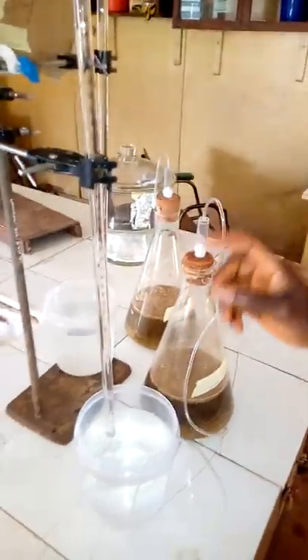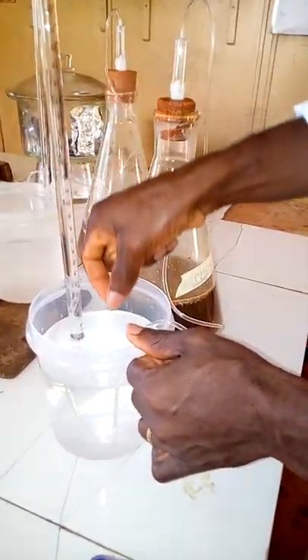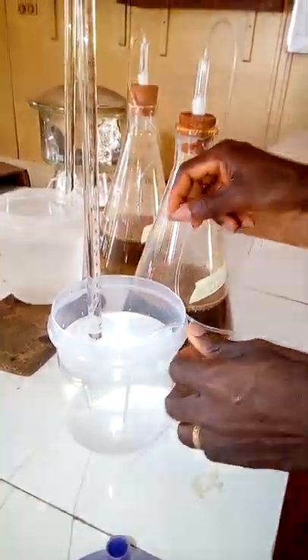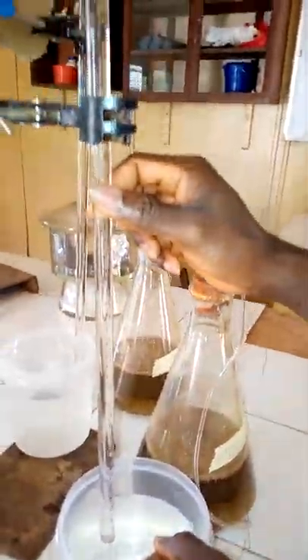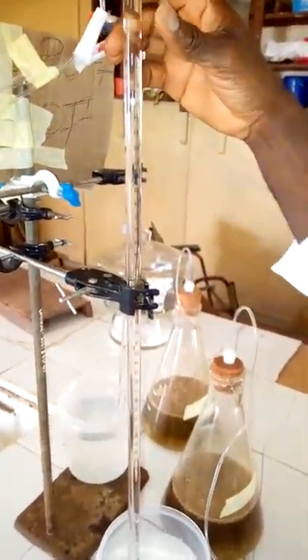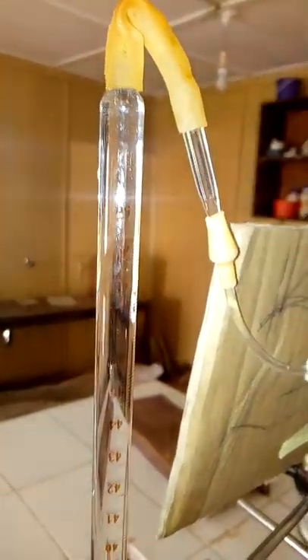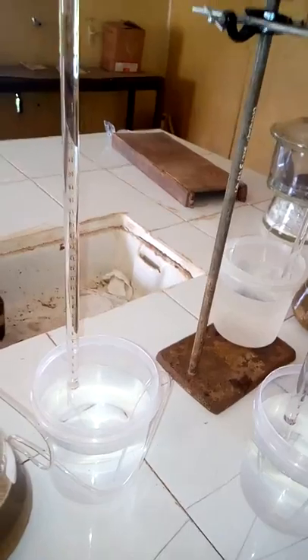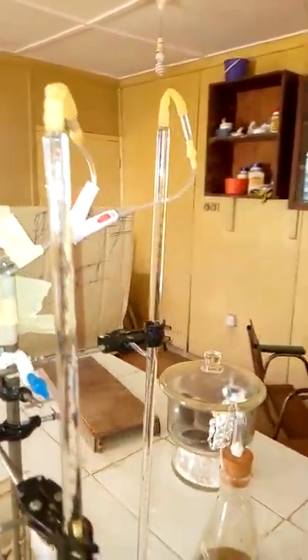To measure the volume of gas produced, a hose carries the gas through a trough containing acidified water and into a burette. The volume of water displaced in the burette equals the volume of gas produced. The setup is made airtight to avoid interference from air bubbles, and a stopper and controller allow us to test the gas if needed.